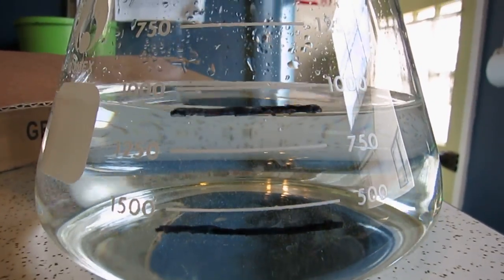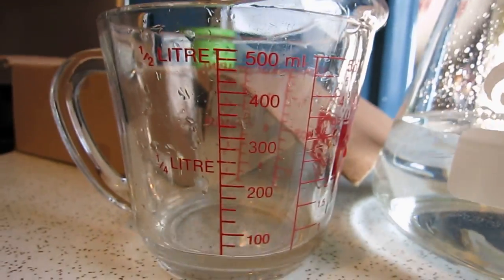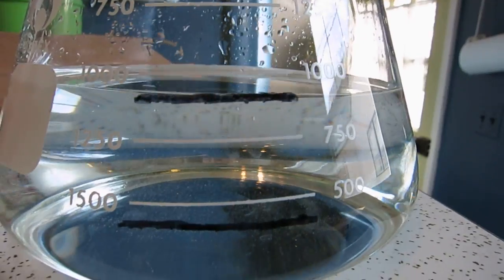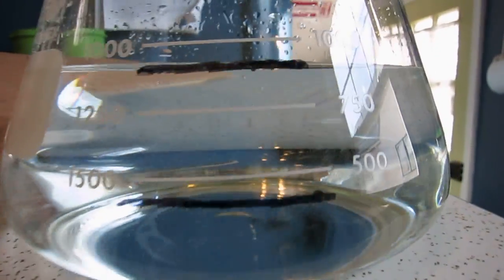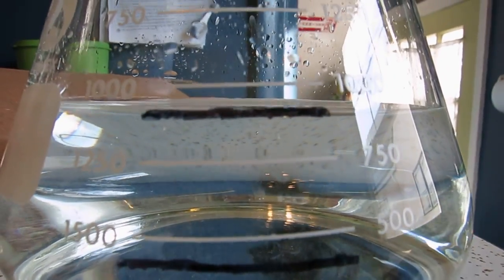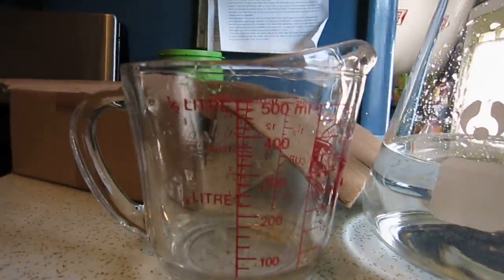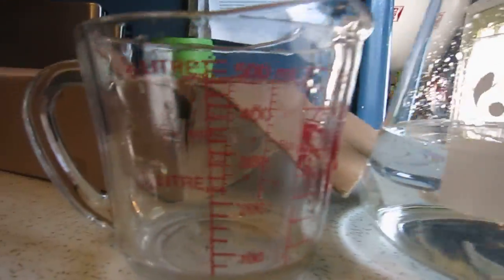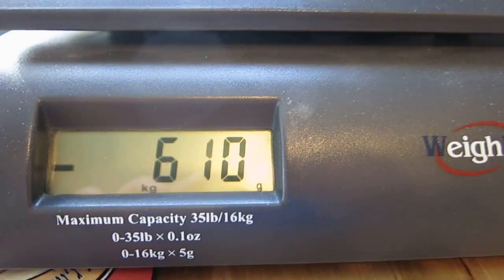But the short story here is that doing this, using this glass, two of these, drawing my black marker, that is about where the liter marker is, and it is a little bit lower than the line that you can kind of see that came. So if you want to check it out, either do a Pyrex glass where you can kind of trust the volume, or do a scale like this and calibrate your Erlenmeyer flask.